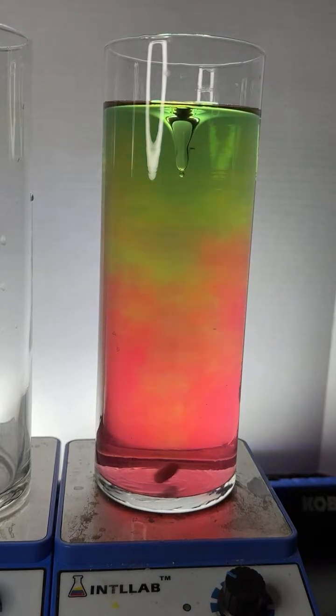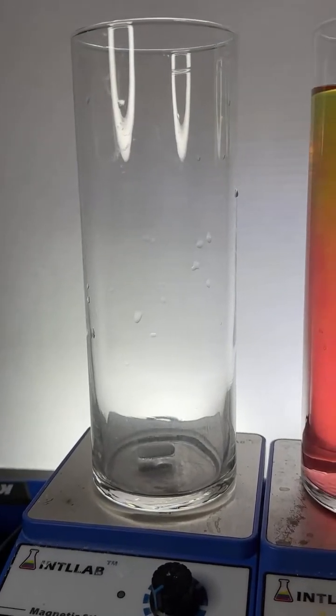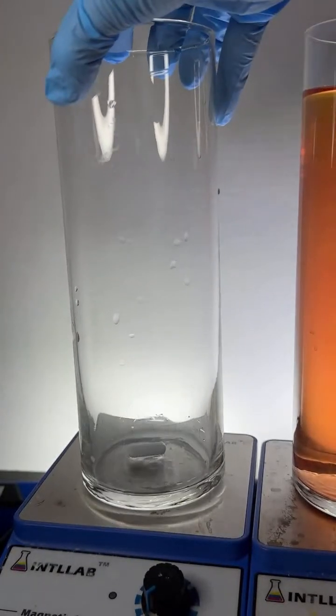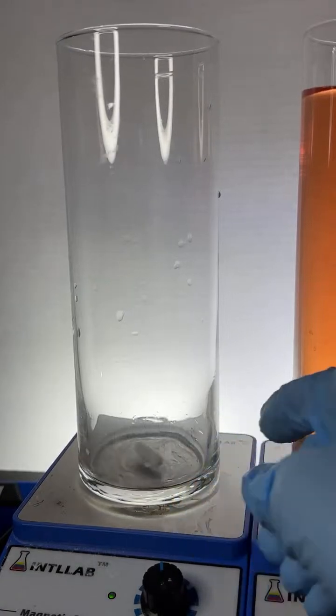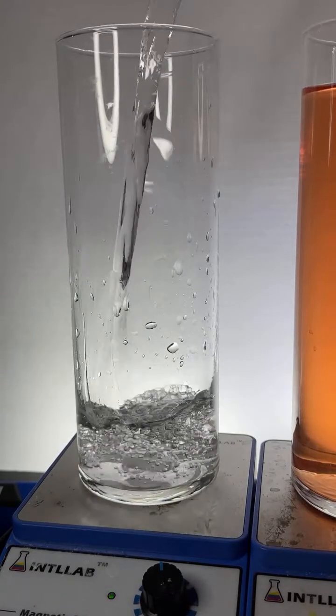Here, let me show you how this works from the start. We'll go over here. There's nothing in this particular flask over here, except a little stir bar. So there is something in here. And I'm going to go ahead and start the spinner down here at the bottom. All right, there we go. Our spinner's going. And now to this flask, I'm going to add some water. All right, in goes the water.